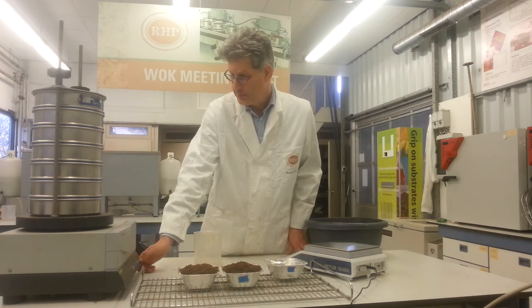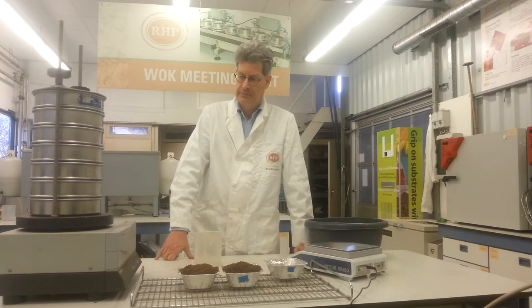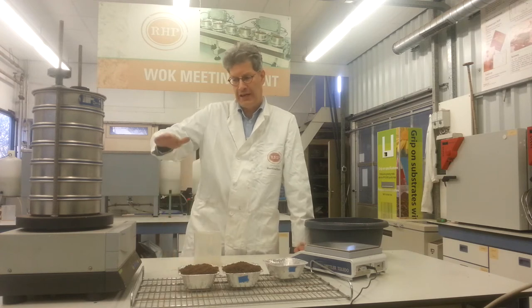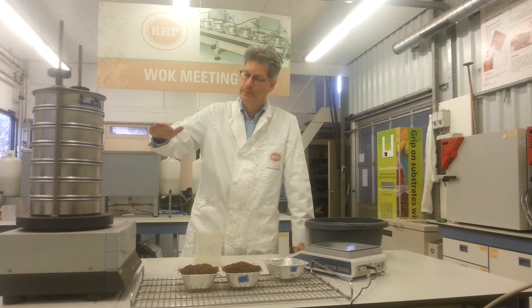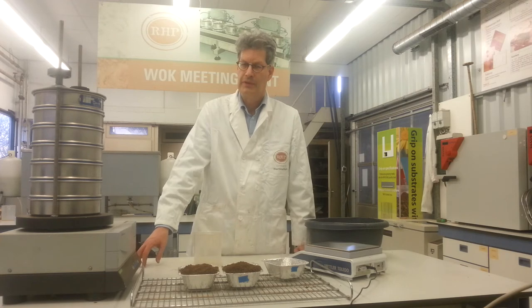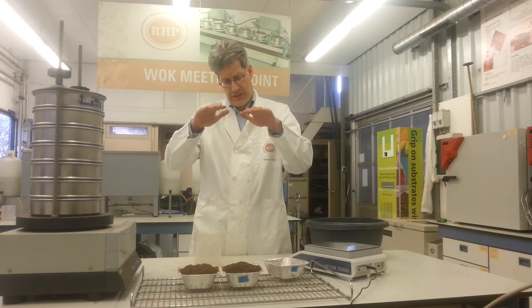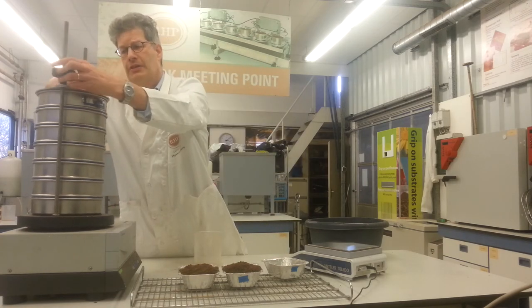You put on the machine — it makes a lot of noise. There it goes, very gently. Every 10 seconds it stops, pausing, and so on. We screen for 7 minutes. After every 10 seconds it pauses so the material can gently fall, find its position, and go further on. After 7 minutes we can take it off.